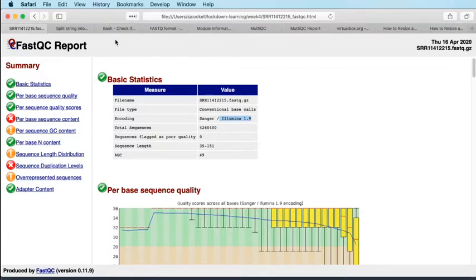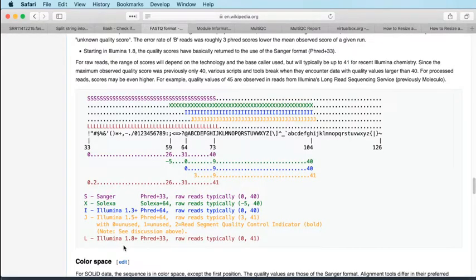And we go back to the Wikipedia page. So that's Illumina 1.8 plus, or alternatively Sanger as well. They're kind of the same scale. But we're looking at this set of L's here. So you can read down by looking at the L's, and these numbers at the bottom, which are the same colour. You can say, okay, well, the hash here is the equivalent to a quality of 2 on this quality scale, which is a low quality base call.